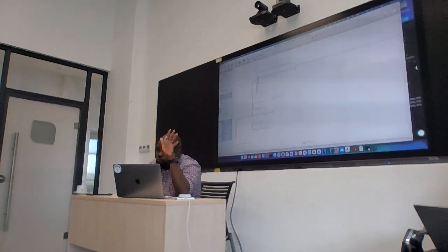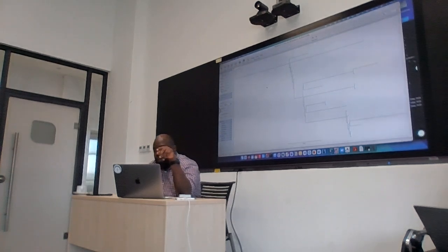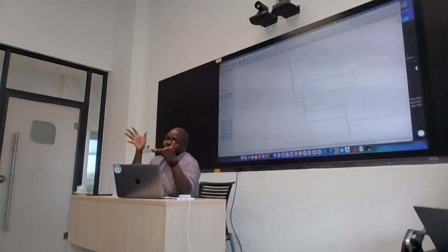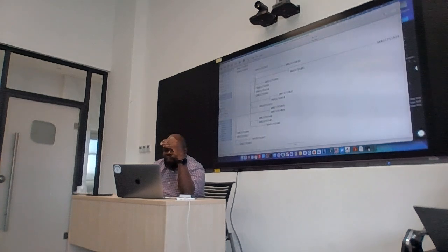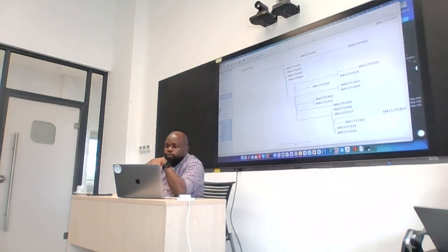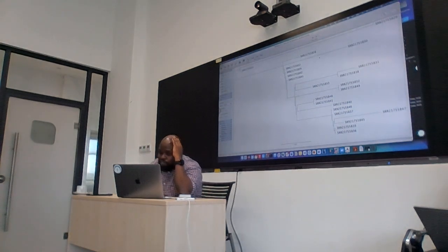So if we look at this unrooted tree, because IQ-TREE doesn't root the trees, repeated with IQ-TREE, okay. Yeah. So here I've done midpoint rooting. People often use it just to give the tree a bit of a balance. Because if you look at this tree in this manner, there are tips. Let me just get the tip labels. You can't see much of a structure, right? But when I do the midpoint rooting, it's essentially putting the root somewhere in between the two most divergent sequences, and you can see that now there's a bit of structure.